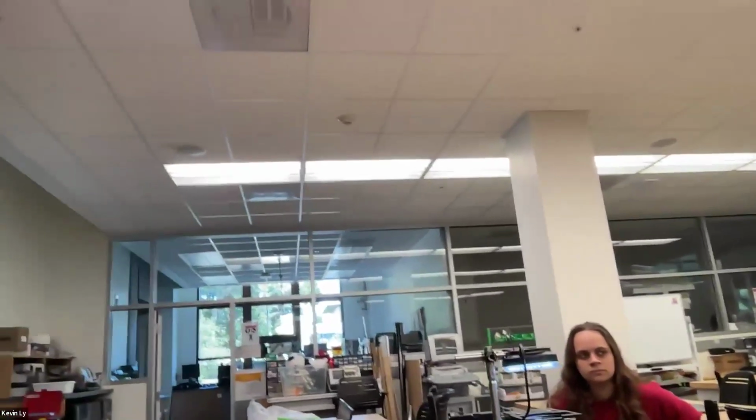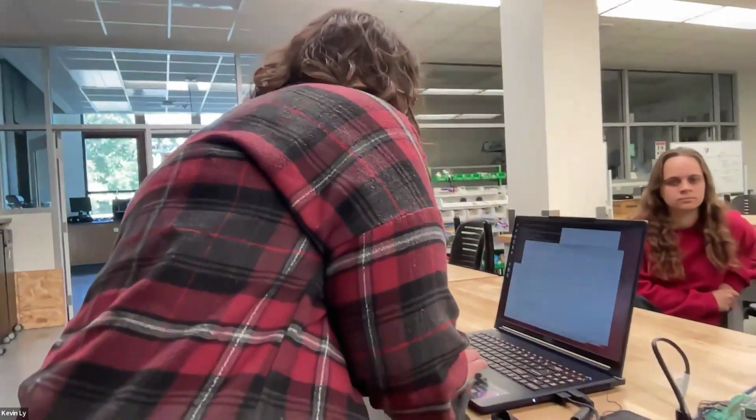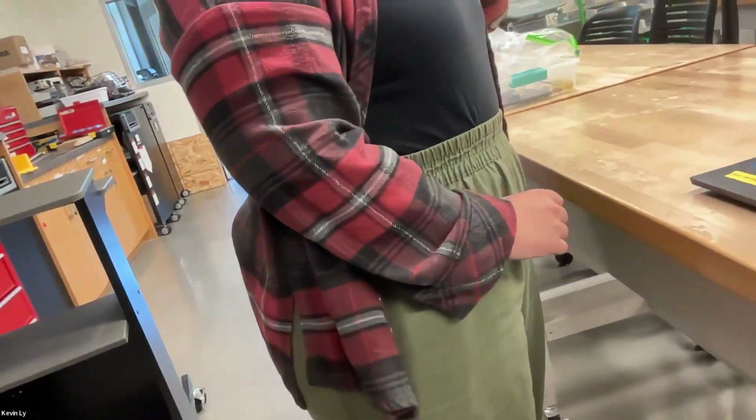We're going to do your thing. So this is throwing a software error. Can you do the main camera only on Octopi Research? Is it a different folder? I just opened the folder that was opened already. Okay, let me try this one.